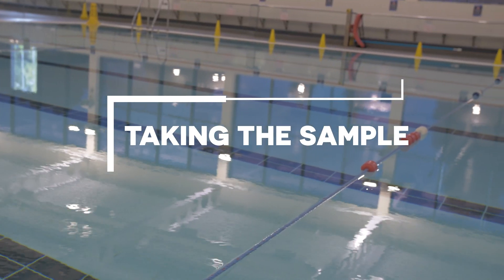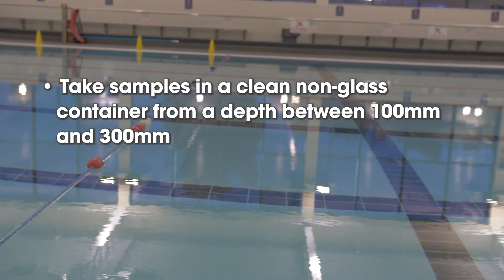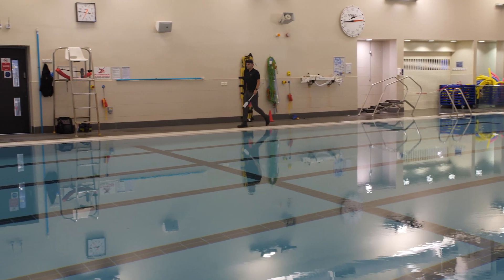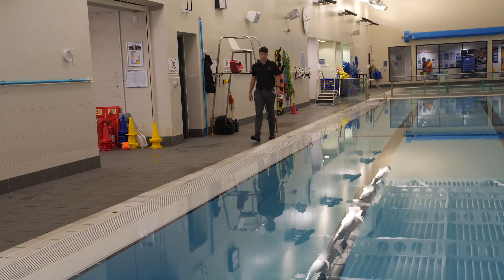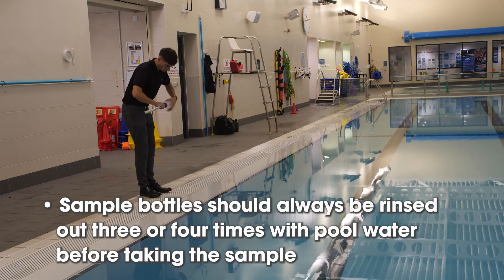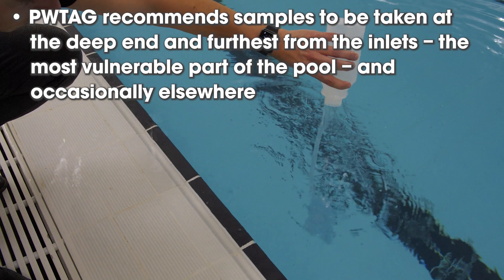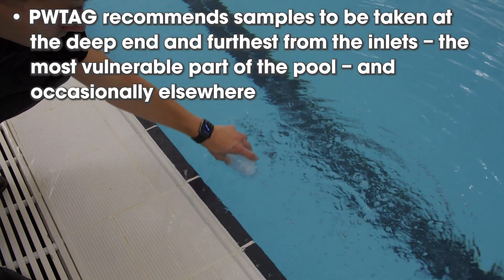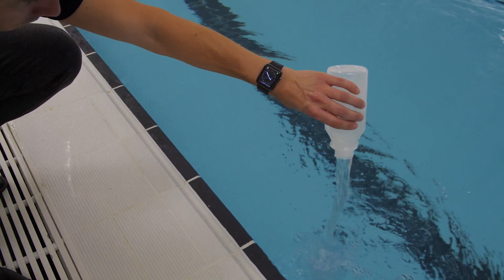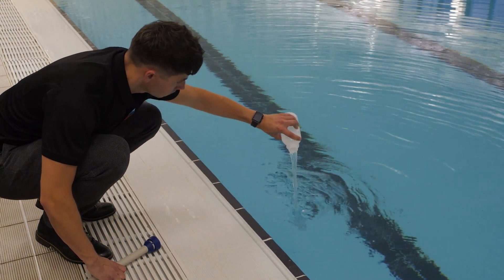Pool water samples should always be taken in a clean non-glass container from a depth between 100 and 300 millimetres. Pool water samplers are the most suitable way to collect water samples. Sample bottles should always be rinsed out three or four times with pool water before taking the sample. Parameters such as free chlorine concentration and pH can not only change rapidly in time, but also vary quite widely across the pool.